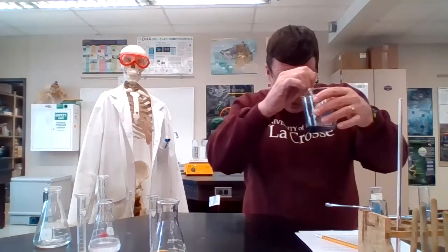Oh, here we go. 2:37. 2 minutes, 37 seconds for the 5 degree.